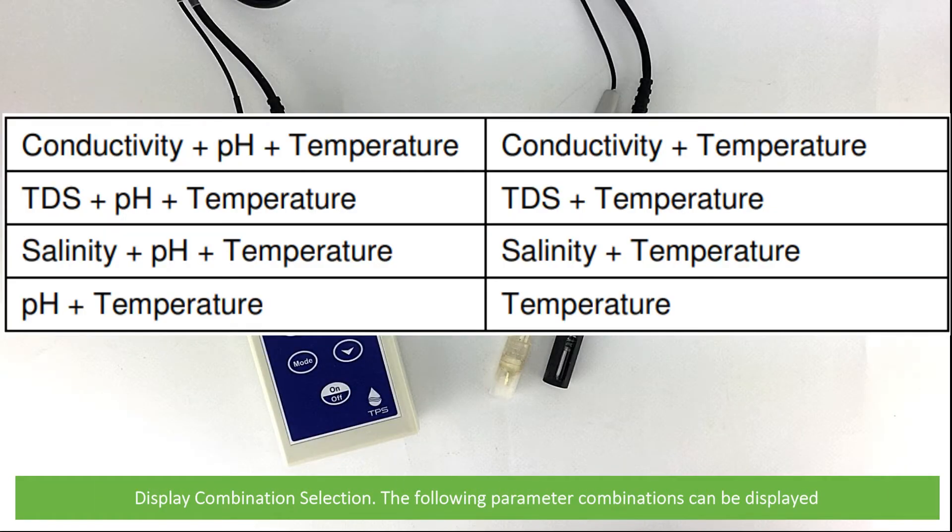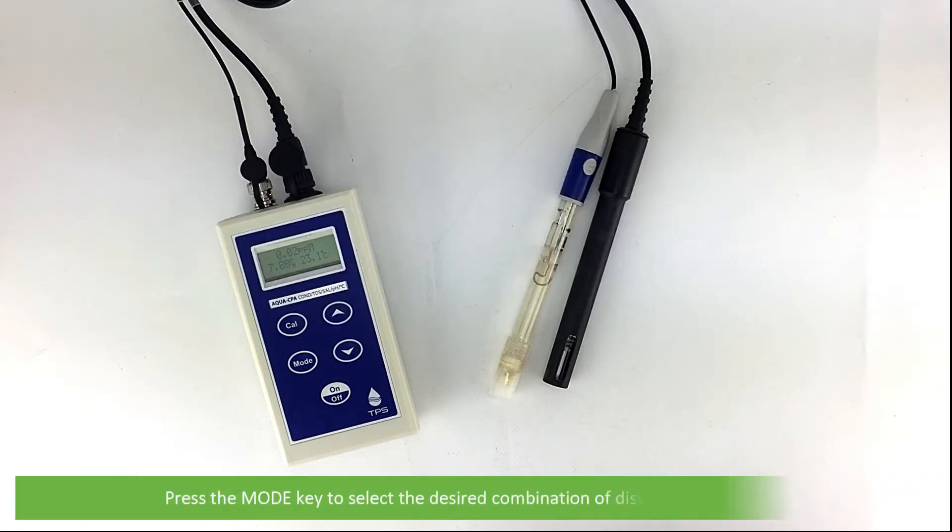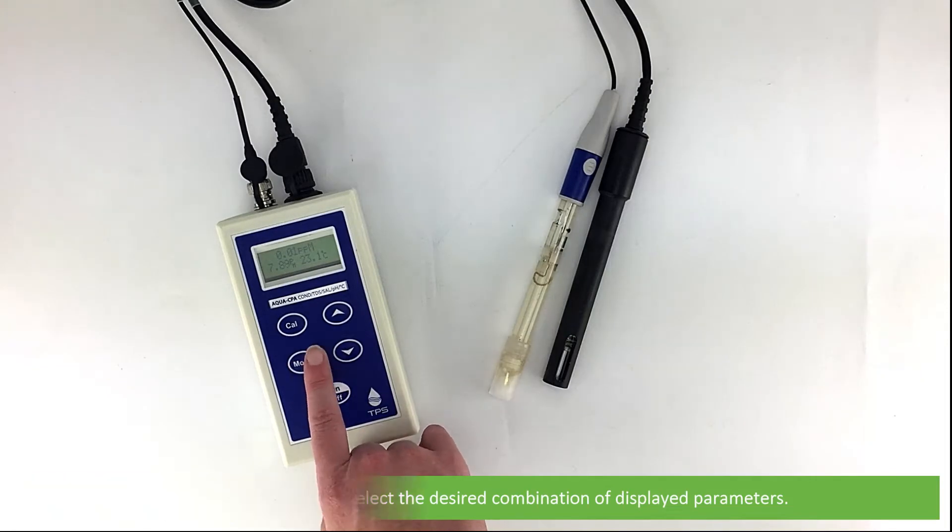Display combination selection. Following parameter combinations can be displayed. Press the mode key to select the desired combination of displayed parameters.